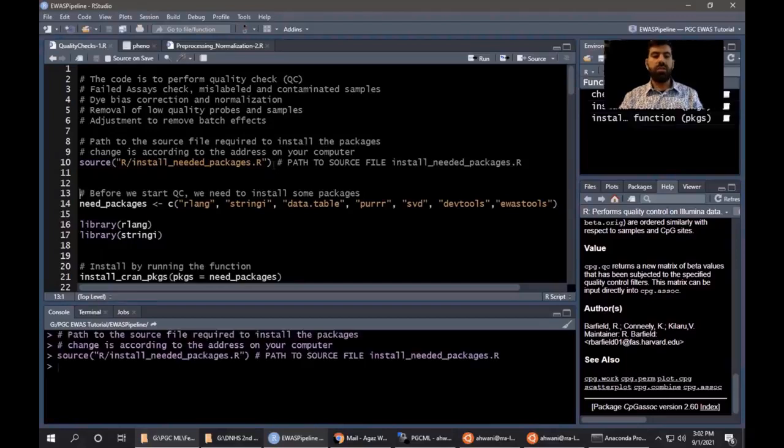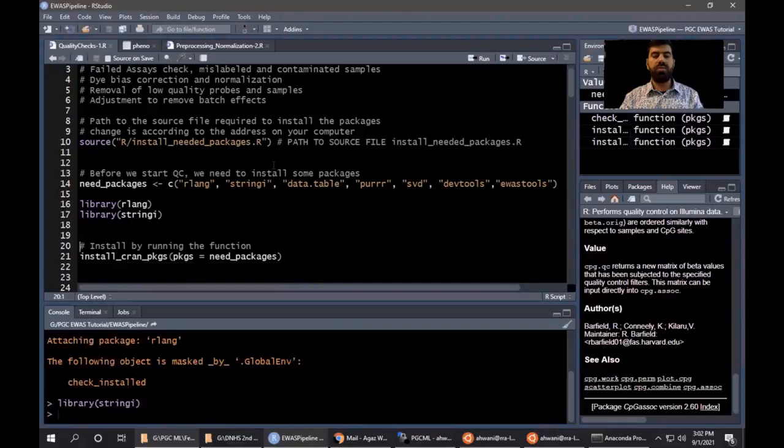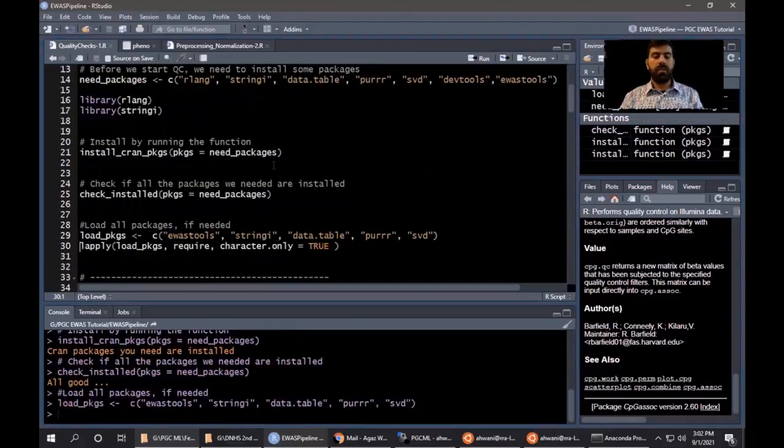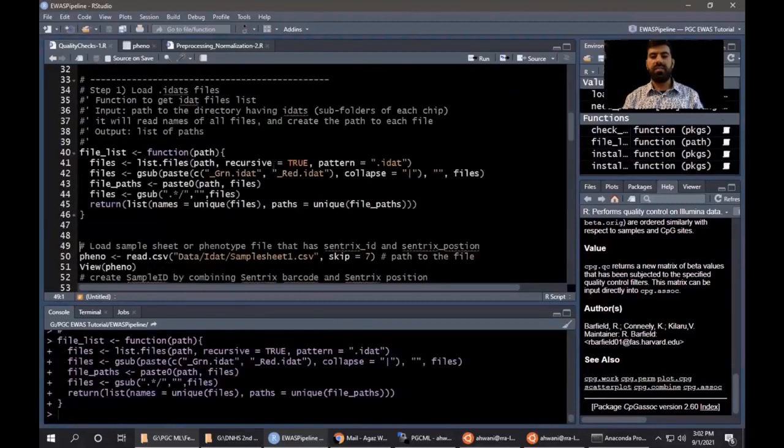So we need to install and load some packages. We will be using EWAS tools to perform quality control checks. So the first thing we need to do is to load the IDAT files, that is the raw data. Each sample has two IDAT files, that is green and red channel.